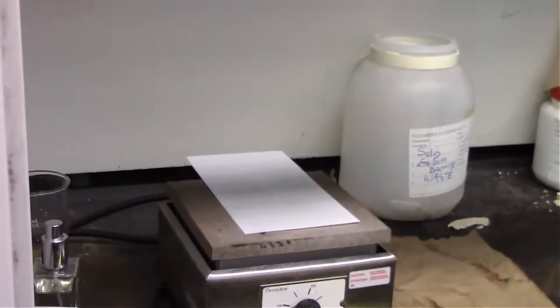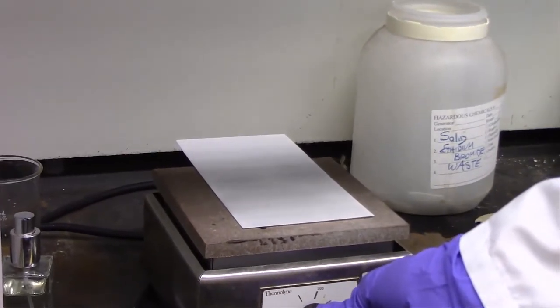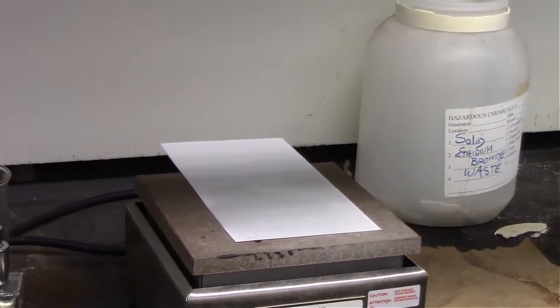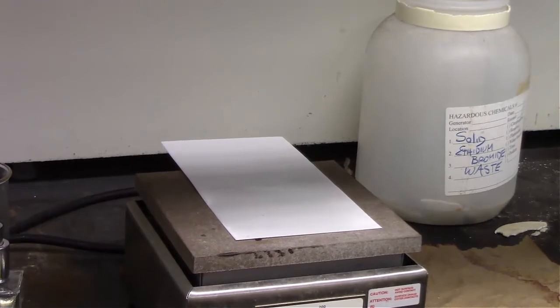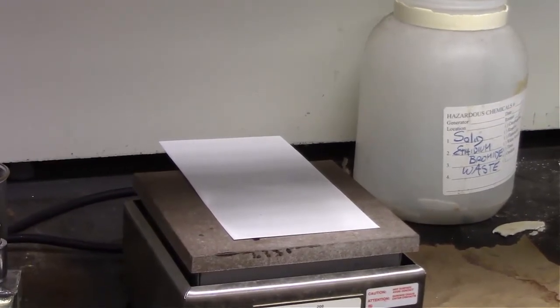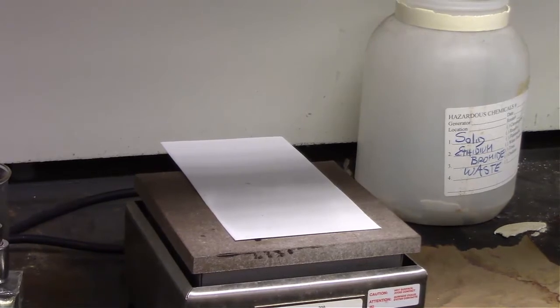On the hot plate, the solvent is drying off of it, so the water and ethanol are certainly evaporating off of the plate, but also our ninhydrin is slowly starting to react with those amino acids. And remember, that was a multi-step process where all we are actually taking from the amino acid is the nitrogen, but there are several steps to actually get it to the point where we have a visible compound, which is the ninhydrin amino acid derivative.